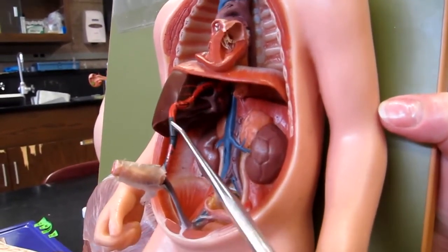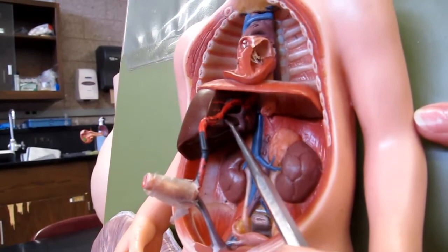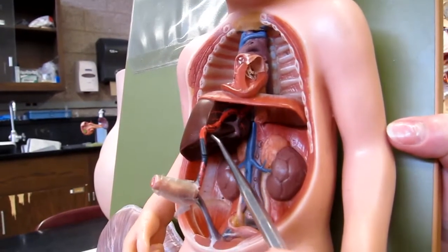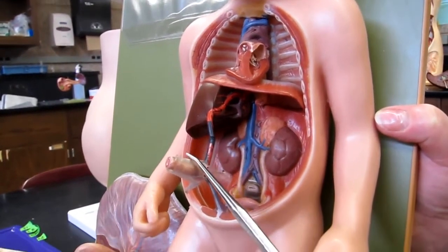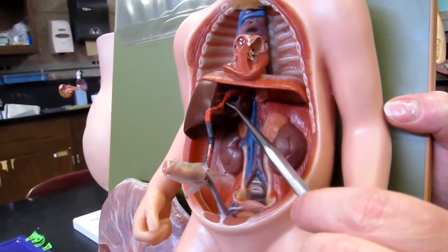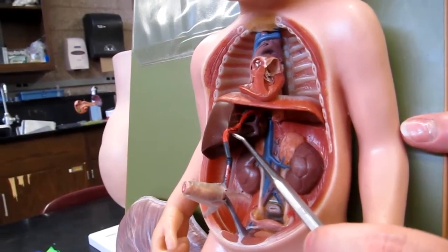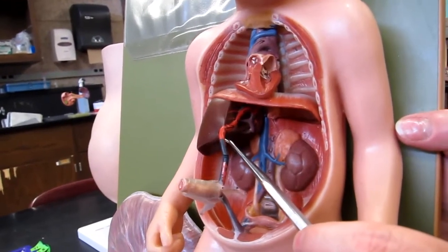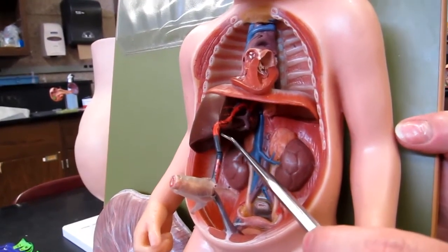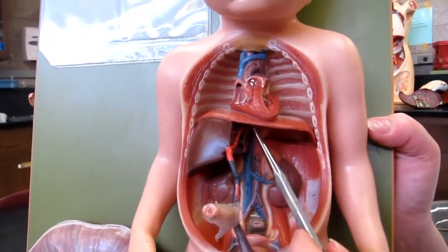Okay, and you can see it kind of cutting diagonally through the liver here. Okay, in the adult, after our umbilical cord has been cut, this will convert into a ligament, the ligamentum venosum. Okay, and you actually have a segment of this apparent on the external surface of the liver, and that is the ligamentum teres, a round ligament that we've been looking at in the laboratory. Okay, so this allows that oxygen-rich blood to get up to the heart very quickly.